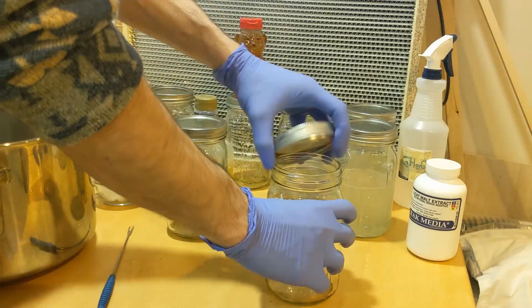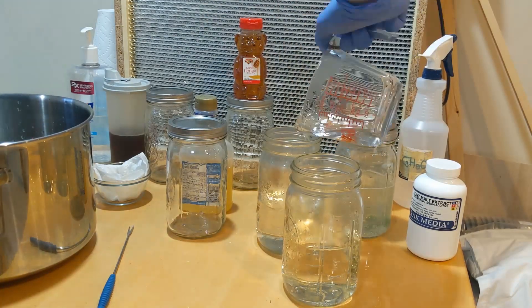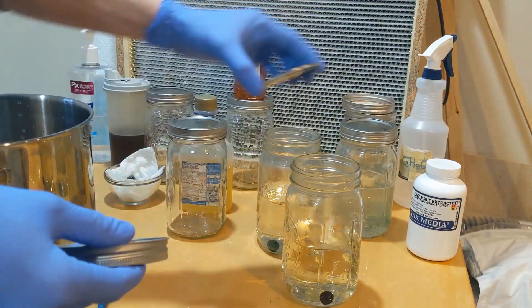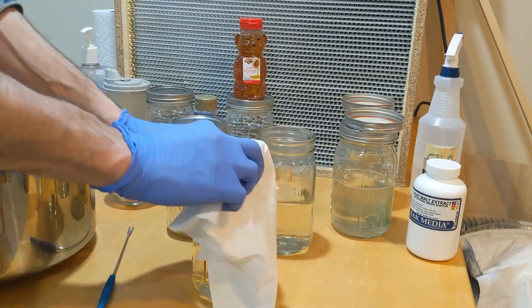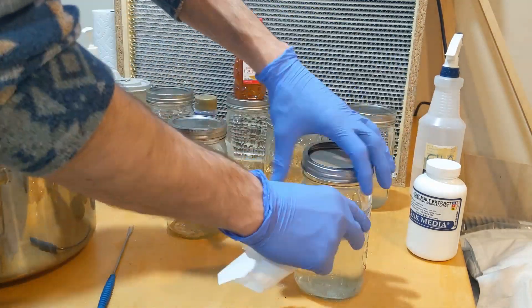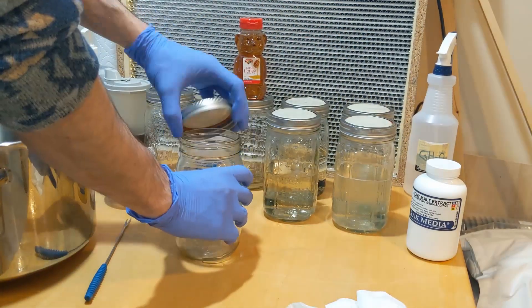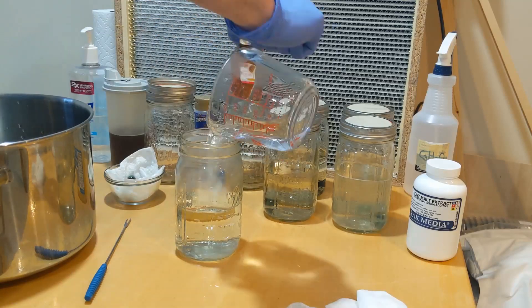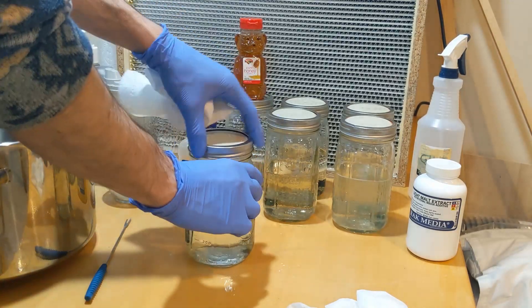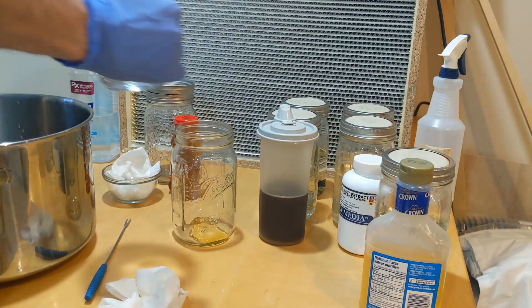Okay, so I'm going to fill up the jars. And looking back at this, I should have flipped the lids already because we're going to... The way we're going to fill up our pressure cooker is we're going to put our lids upside down. That's going to allow a little bit of air exchange so our jars don't blow up. And you can see me go back here. I forgot to do it on the first one with the light malt extract. And very important as well, we're going to wipe the lips with some rubbing alcohol as well as that's the only area that could potentially harbor bacteria. So wiping all the lids and then I'm just placing everything in front so I don't get confused as to which liquid culture is which before I label them.